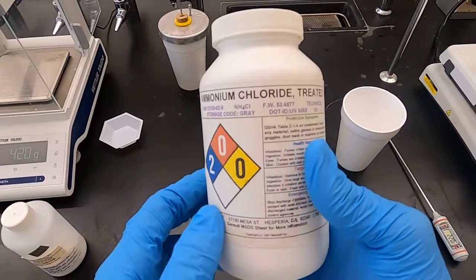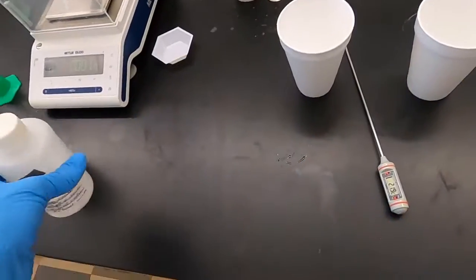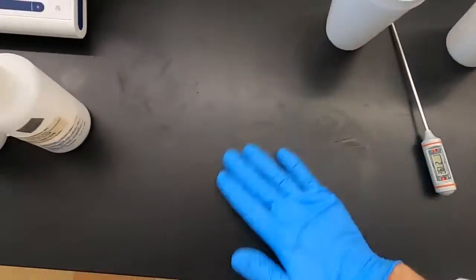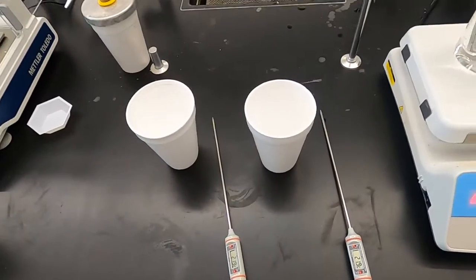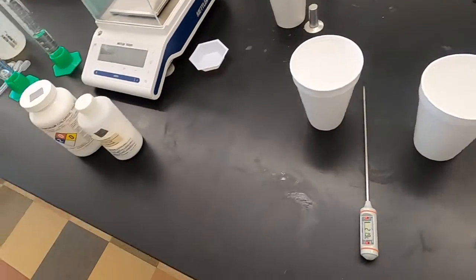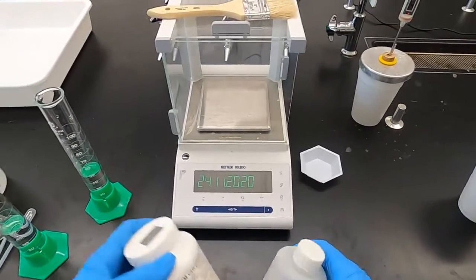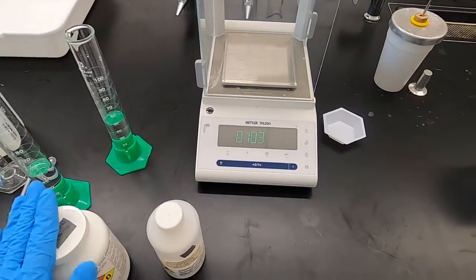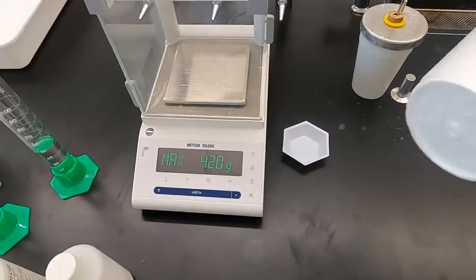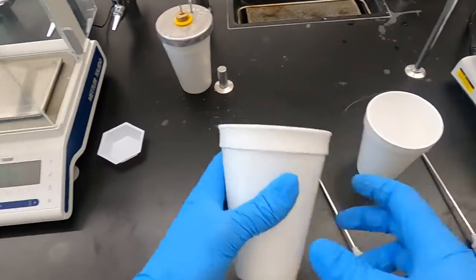So we have ammonium chloride and calcium chloride. The third one would have been sodium chloride. That's salt. Most of you would probably guess what that change would be. It's not a whole lot, but maybe do that in another lab when it's in person or even at home. But for this instance, we are gonna do part 2 with these 2, and it's basically like part 1. We're gonna start with our calorimeter. We have 2 ready to go here. We're gonna weigh this.